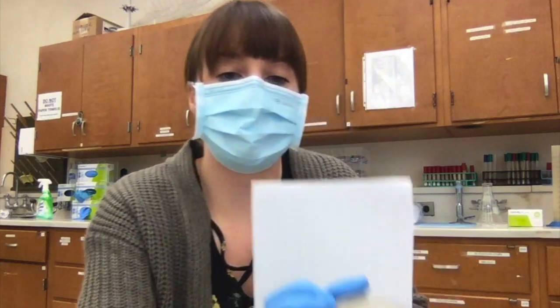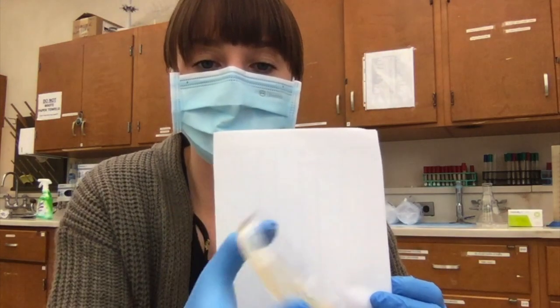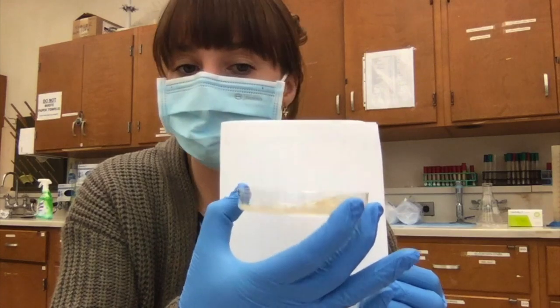Now one of the issues you can have when pouring plates or making your plate media is that the media can cool too quickly, and as you pour it, it comes out chunky. This would be the result of something like that, where you get chunks in there, which would not be adequate for growing bacteria at all.